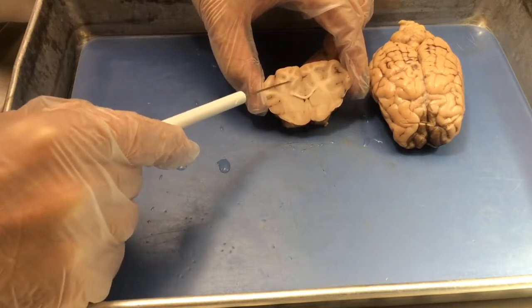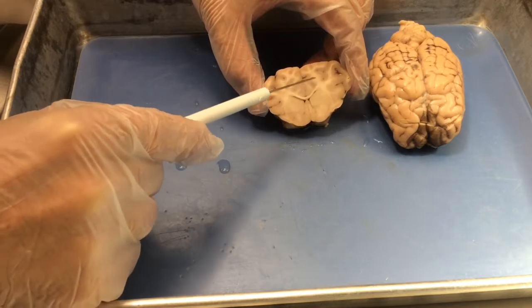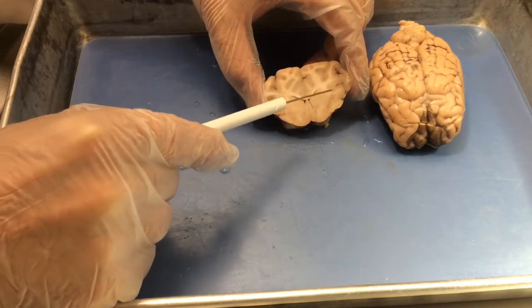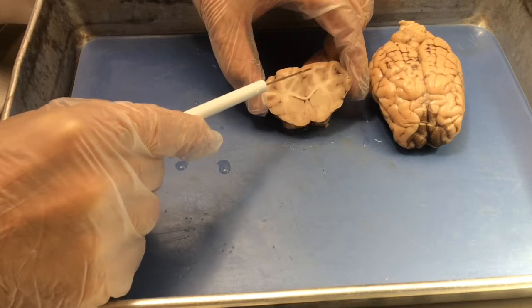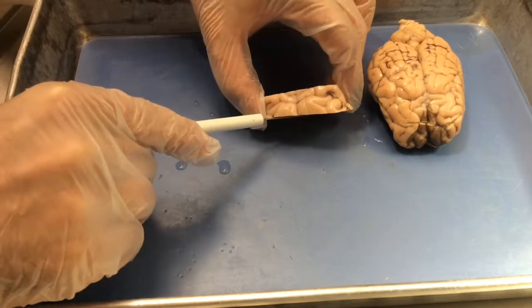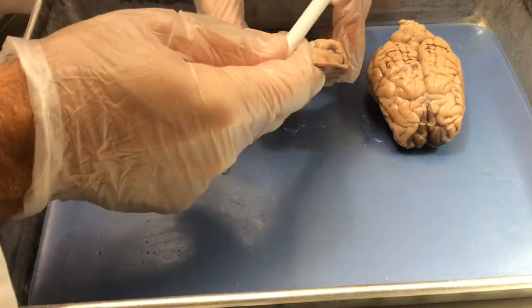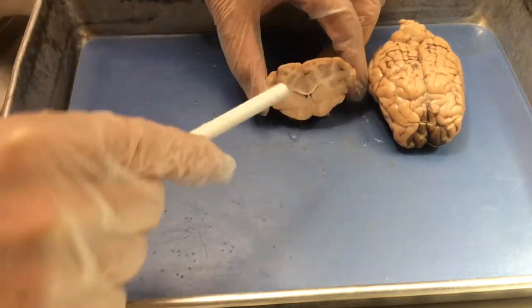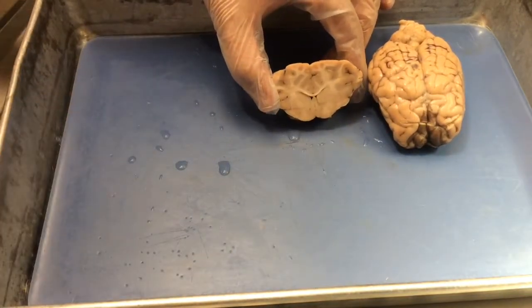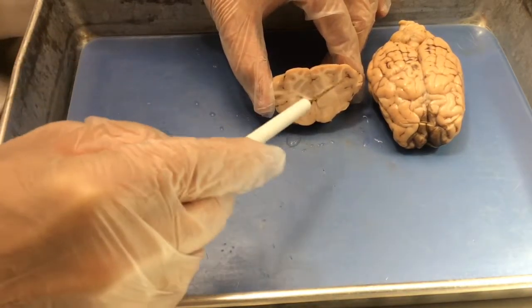In this section, more than half of the section is dominated by cerebral cortex. Cerebral cortex consists of these loops of gray matter interspersed by regions of white matter, and usually you can get pretty good contrast of those two areas. As you know, if we flip it further, you can see the gyri and sulci on the dorsal surface of the brain, which is the upper part of the cortex. And all this is cerebral cortex.